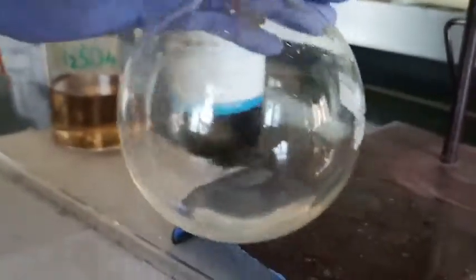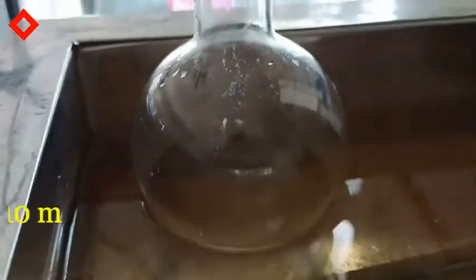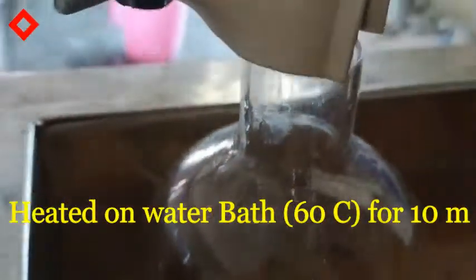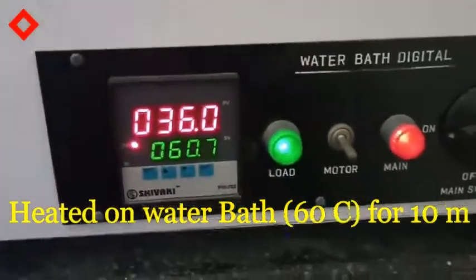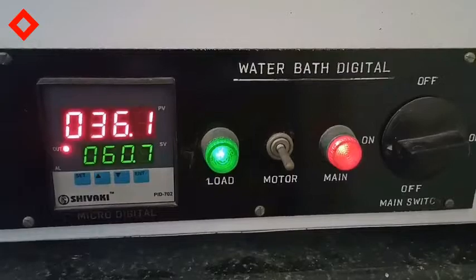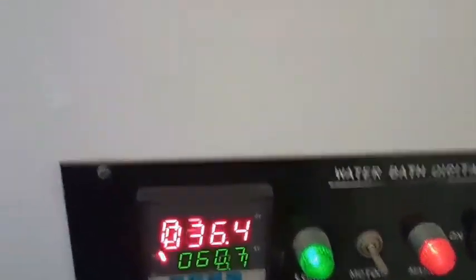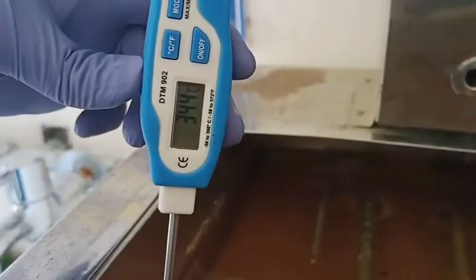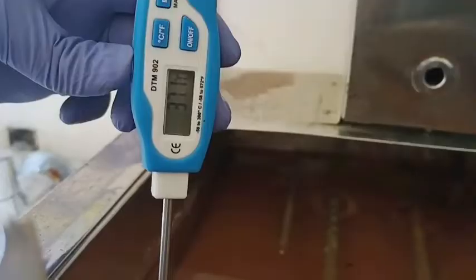On adding the sulfuric acid I shake it again just to mix thoroughly, and now we are putting it in the water bath. The temperature of the water bath has been set at 60 degrees centigrade — currently showing 60.7 degrees centigrade and the current temperature is 36.3. In the water bath the temperature shows 34.4 degrees centigrade and is now increasing to 36.6 degrees centigrade.